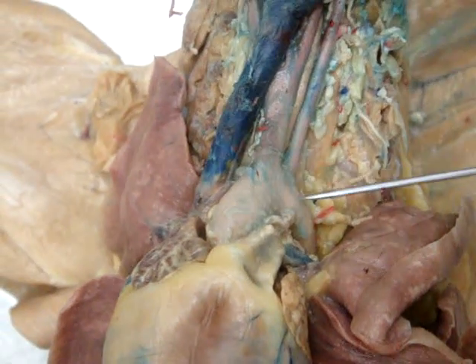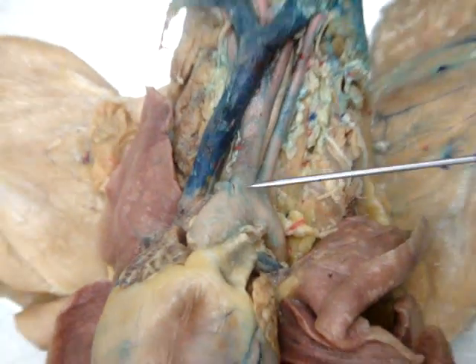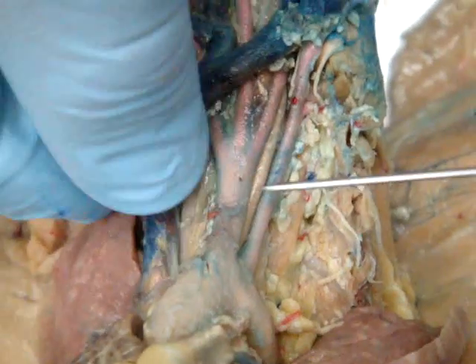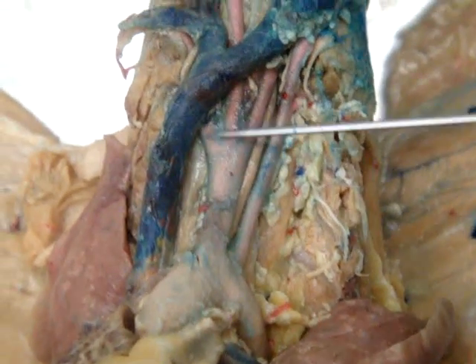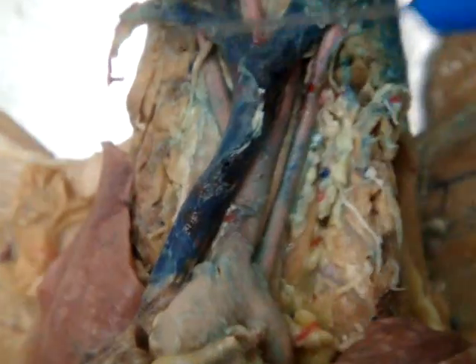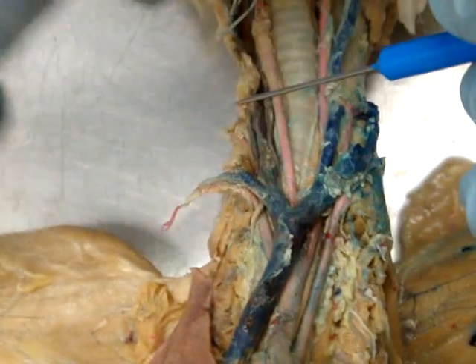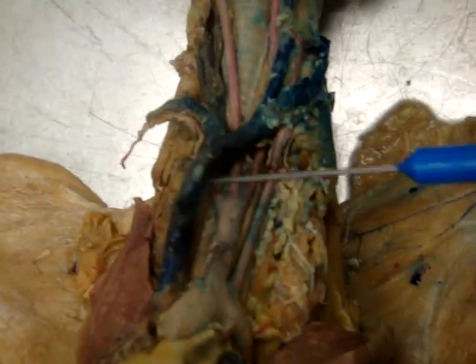This is an aortic arch, and this is the brachiocephalic. The brachiocephalic splits into the right subclavian, which goes up and has the mammary off the top of that, and as it continues it eventually becomes the right axillary artery.